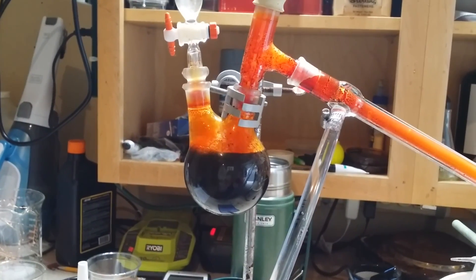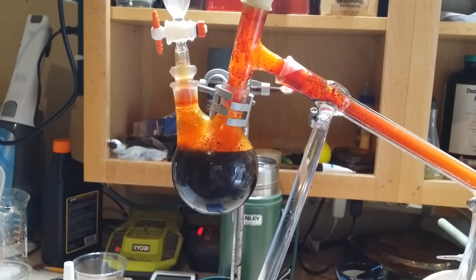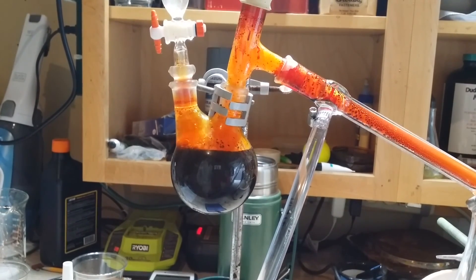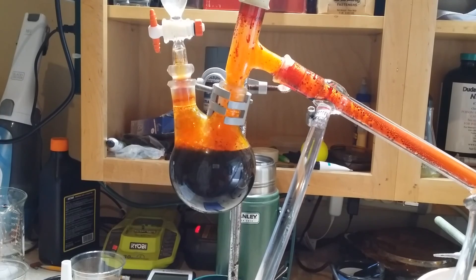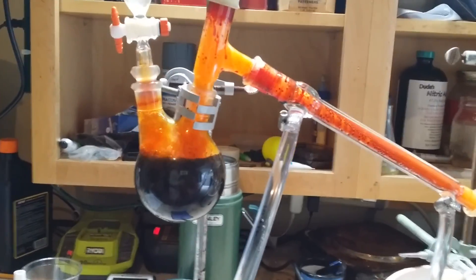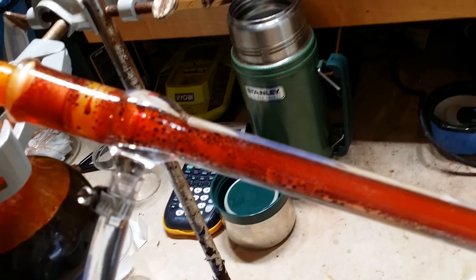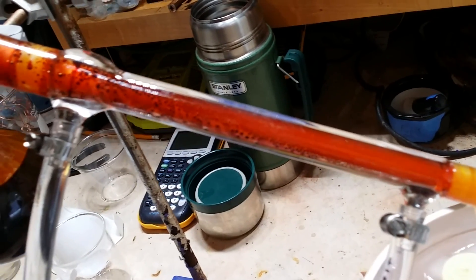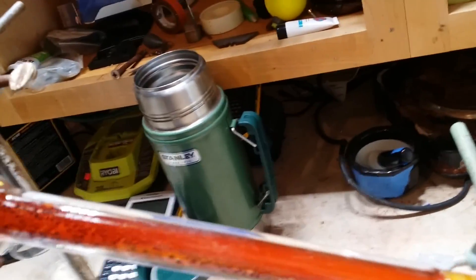The reason the bromine is already boiling so much is that we are adding concentrated sulfuric acid to water, and when you do that, a lot of heat is released. If you feel the reaction flask, you'll notice it's become quite hot — more than hot enough to boil the bromine. Notice in this condenser tube those dark red droplets of liquid. That is bromine in liquid phase, simply transitioning from gas to liquid since we're cooling it with the cold water in the condenser tube.